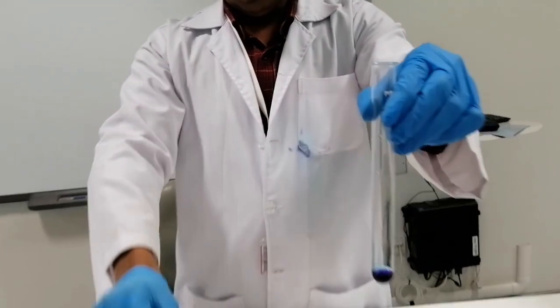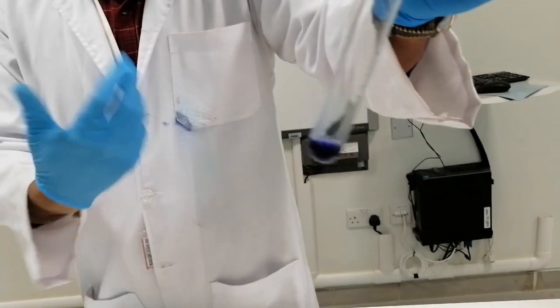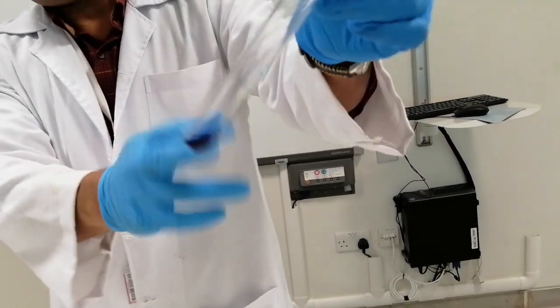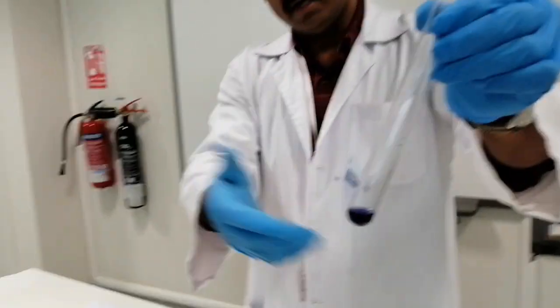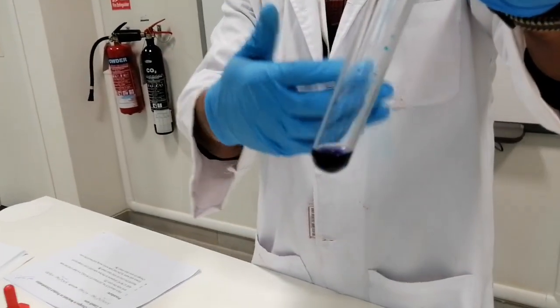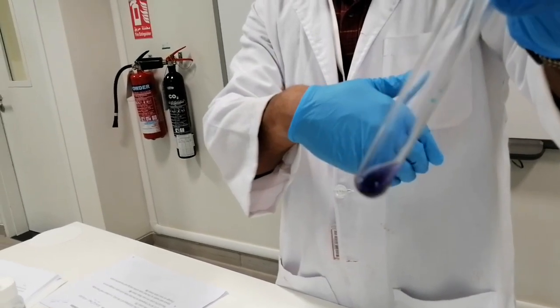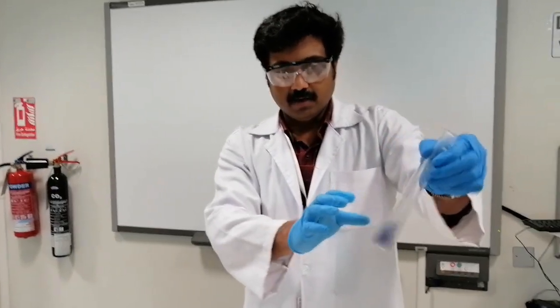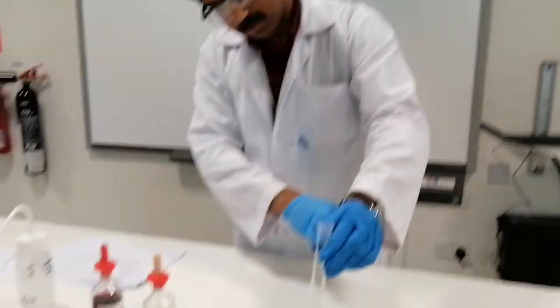You can see that now the color turns to a kind of dark blue. It's supposed to be a very dark blue color, but you remember that this is not really dark blue. It looks like a slight violet color. This is because of the equilibrium. As I explained, in the equilibrium we have both reactants and products. So we have the wine red reactant and also the dark blue product. That's why the solution looks a little bit purple. So this is the equilibrium. Now you have reached the equilibrium, so you can keep the test tube here.